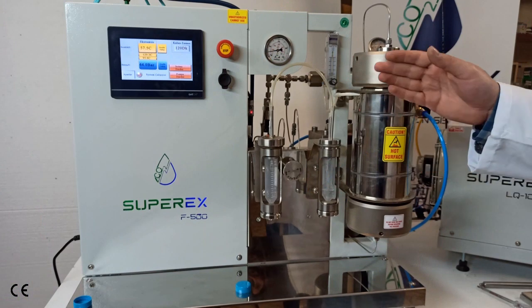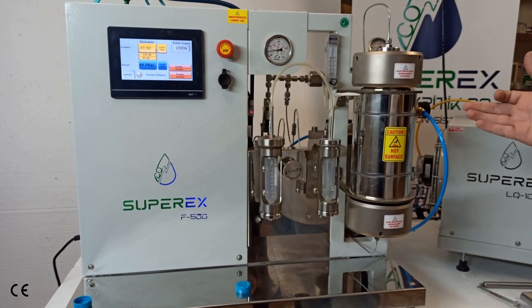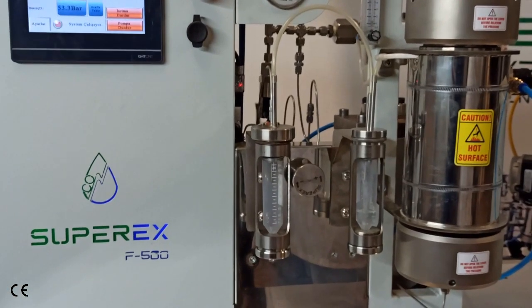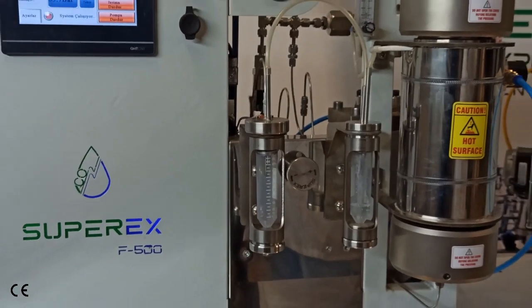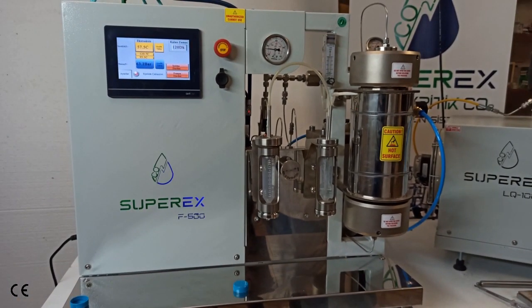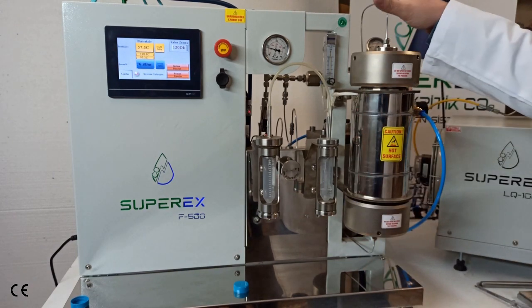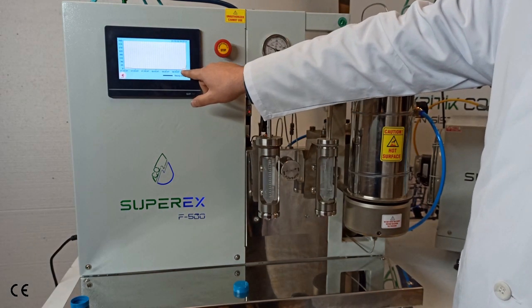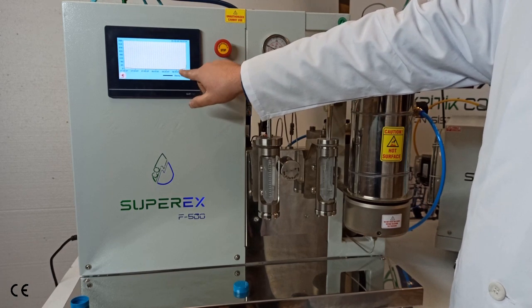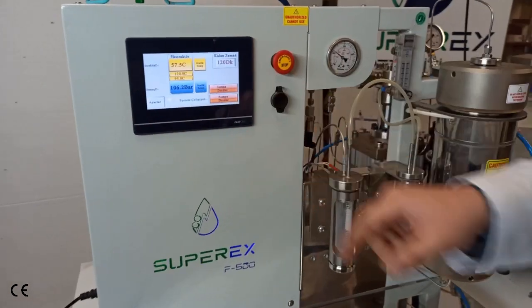The pressure is increasing rapidly because of the liquid phase. We are now using R134a gas in a subcritical state because the critical temperature is 100°C, so we are applying high-pressure subcritical extraction. On the graph you can see the pressure increasing rapidly.